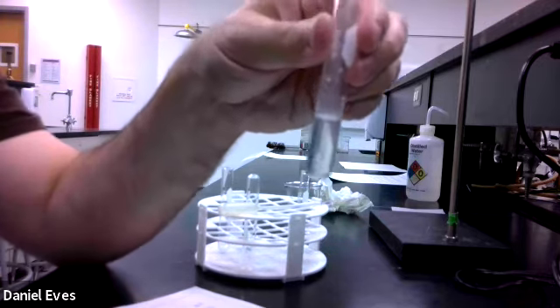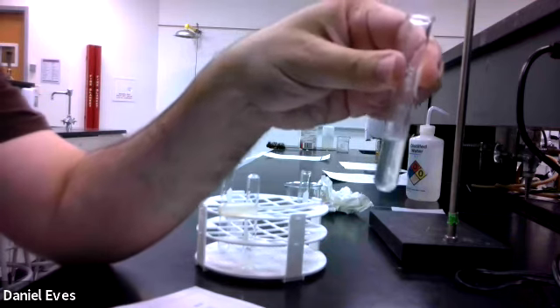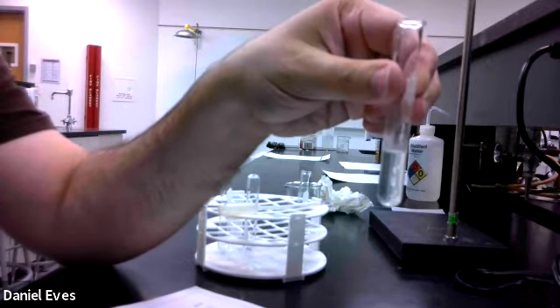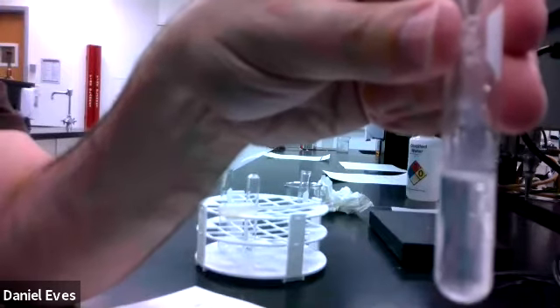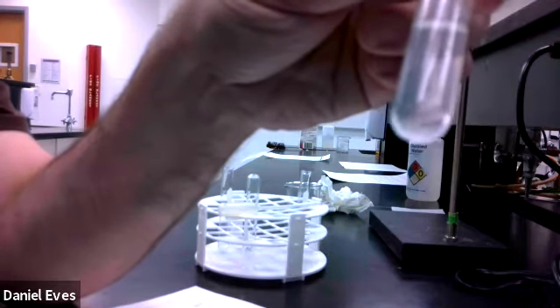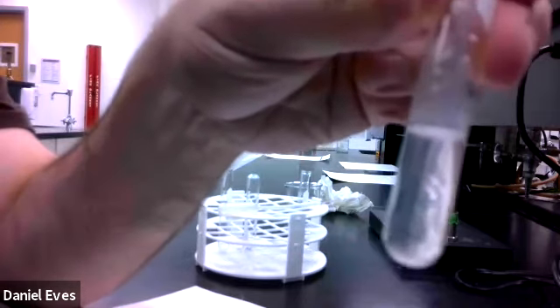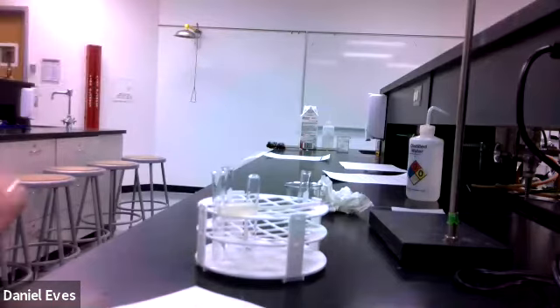I don't know if you can see, but we are making little crystals. That may be hard to see in all of that. There is some solid starting to form inside of that. So we're shifting the equilibrium back towards the solid. So we're getting some solid precipitation coming out. And so we have shifted from the solution to the solid. So we're getting precipitate. And so that's what should happen in all of that.